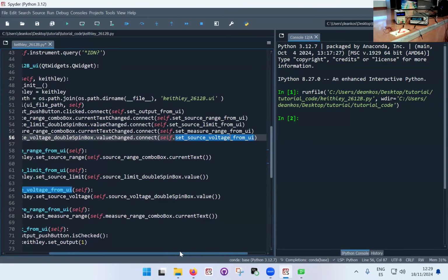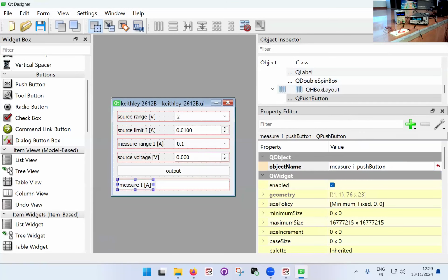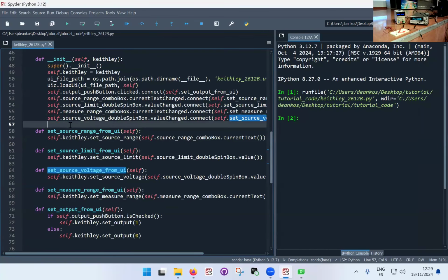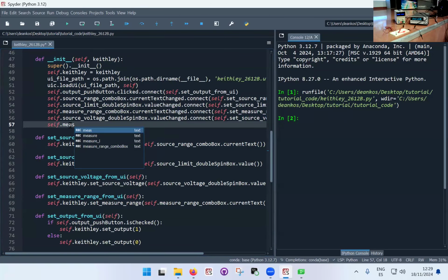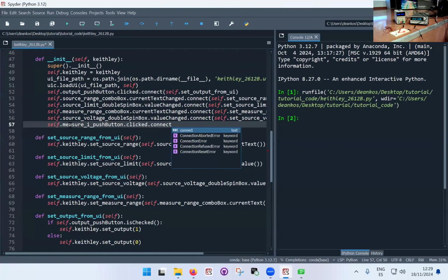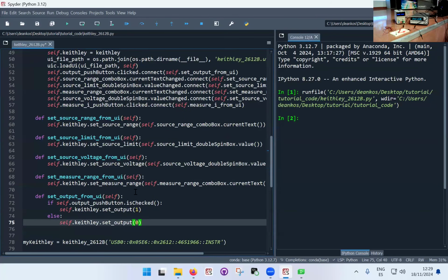Okay, so this in principle should do all we want, and then we finally have the measure button. And so for this, I can already predict that we're going to put a function here, self dot measure I push button dot clicked again dot connect, and we're going to put this measure I from UI. There we go, done. And now we need to implement this function, which we're going to implement just down here.